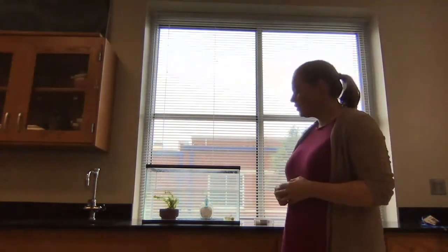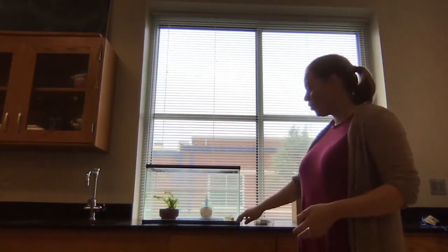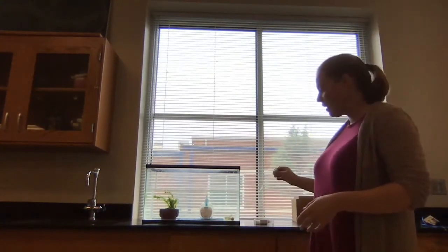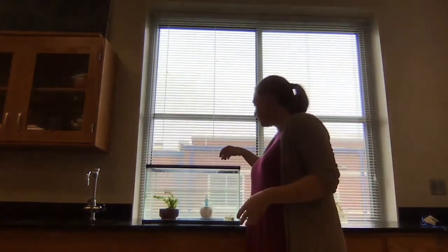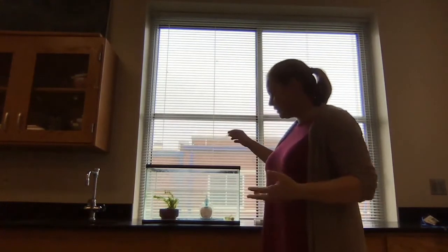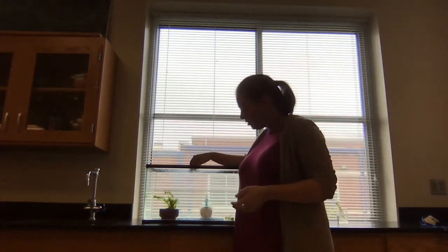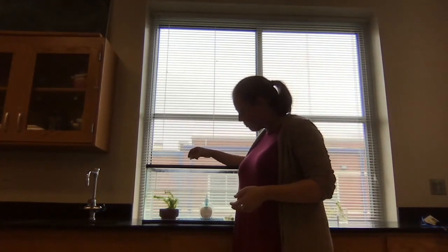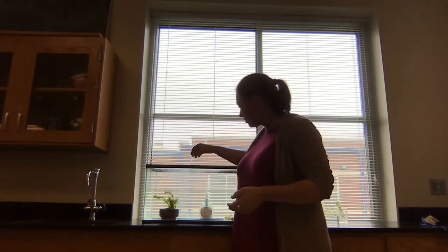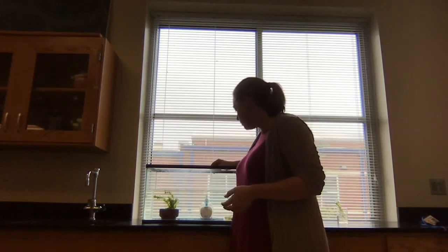So now we are going to see if we can find some living protists in this tank of water that's been sitting here over the weekend. It's got a little bit of slimy stuff that looks like it's growing on the top. So I definitely want to get some of that slimy stuff in my pipette, and I want to go around at the bottom and get a little bit of what I see growing at the bottom and maybe even in these rocks. So I'm going to just try to get a little bit of water from all over.